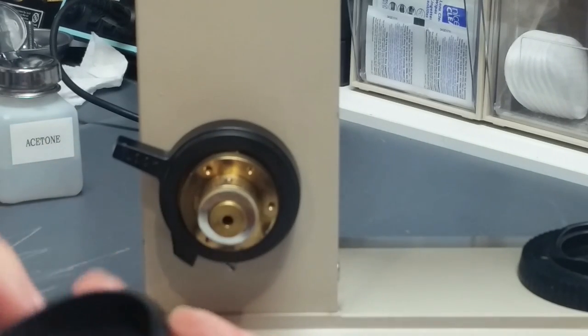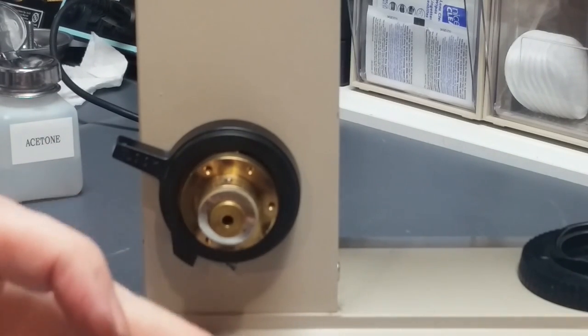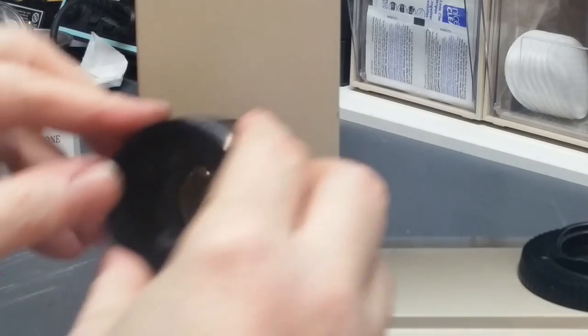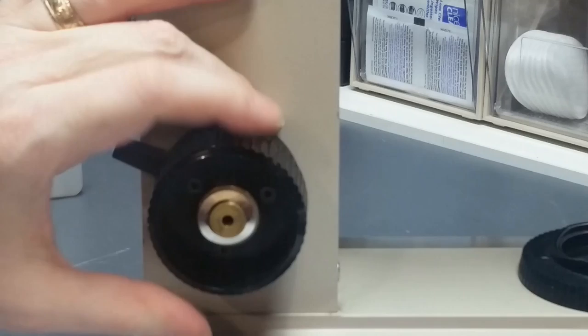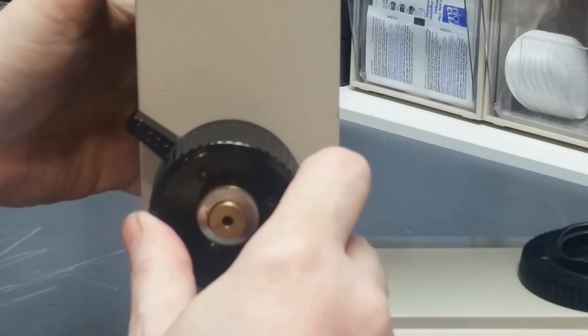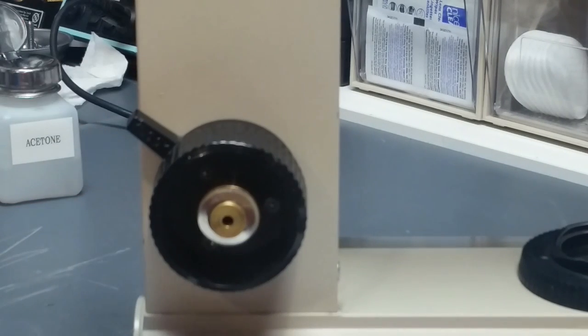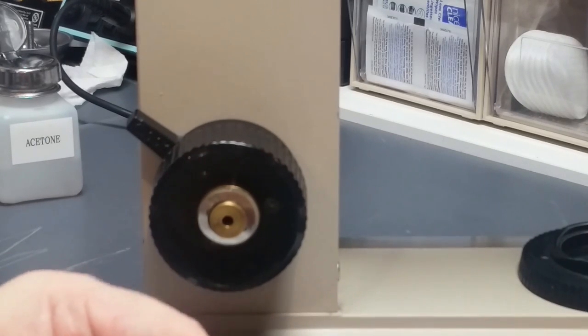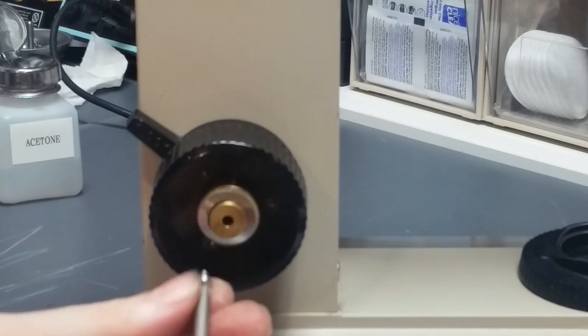So you've got a deep side here, shallow side. Put the shallow side towards the scope. Place it over there, and align your three screw holes with the tapped holes in the brass piece, and those are symmetrical, so that's easy enough. Now we take our screwdriver, make sure we get the right one that fits it. Let me put these screws in.